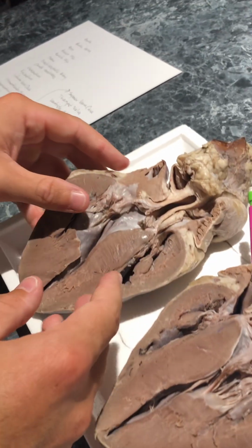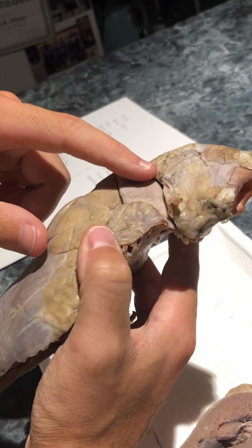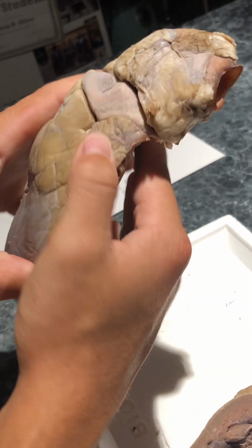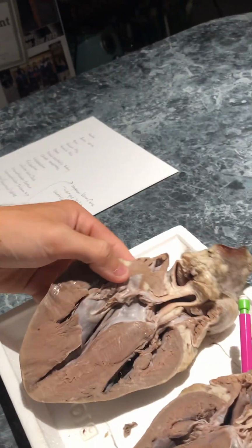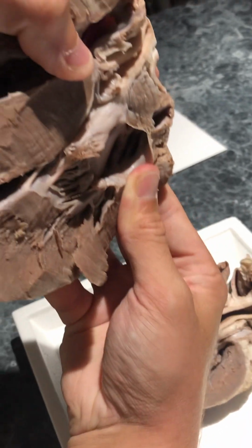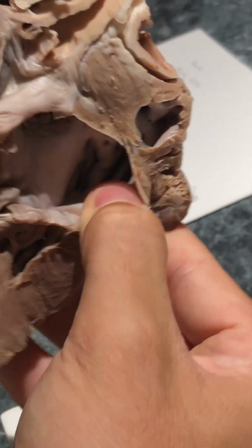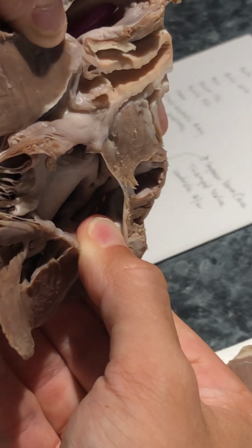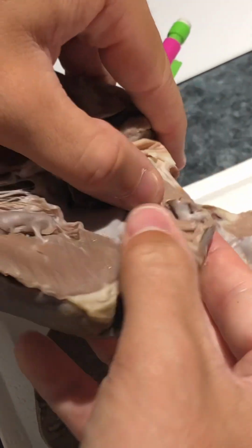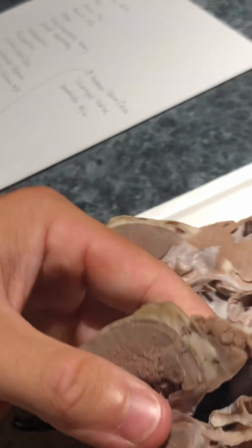Then we have the pulmonary trunk here. I think I skipped over that one by accident, but before the pulmonary valve, you would have the pulmonary trunk. And then next thing we're looking at is the pulmonary veins. So the pulmonary veins would be in here. Might be hard to see, but it'd be in here, and it's like these little structures. These would be the left veins closer to the right side here, and then the right ones would be kind of in here. It's kind of hard to see. I think it's kind of cut off a little bit.